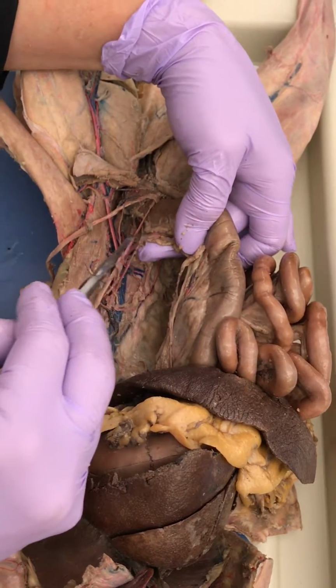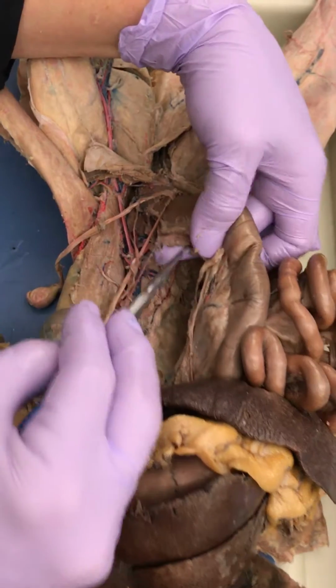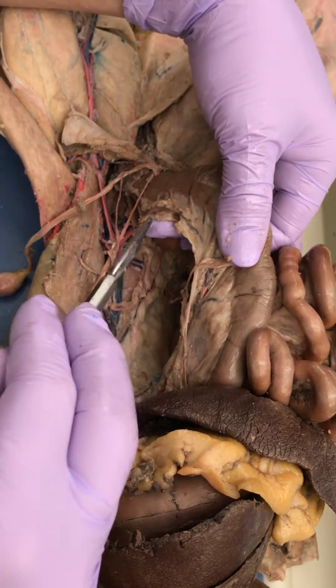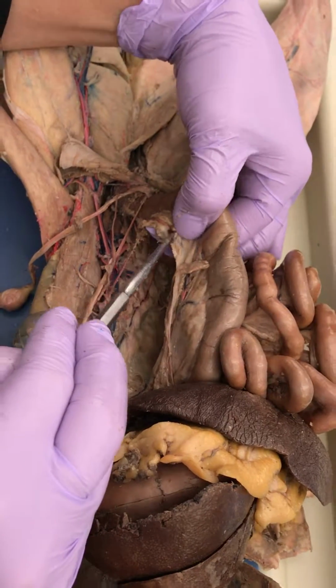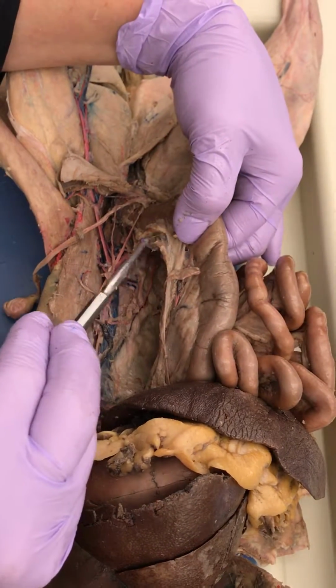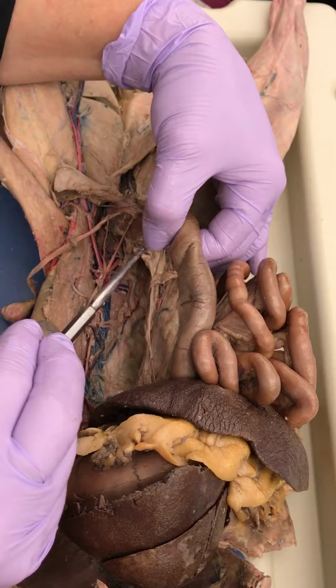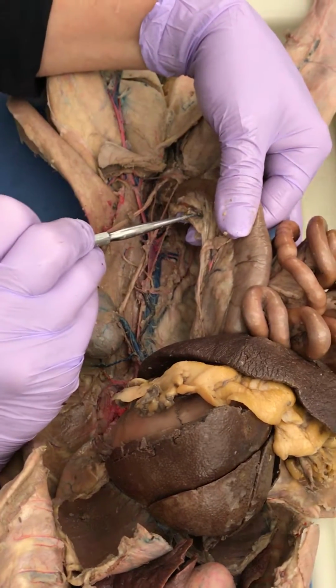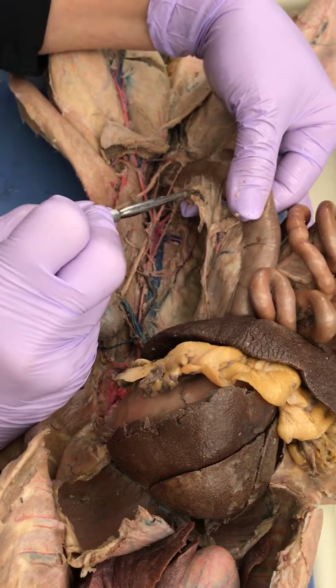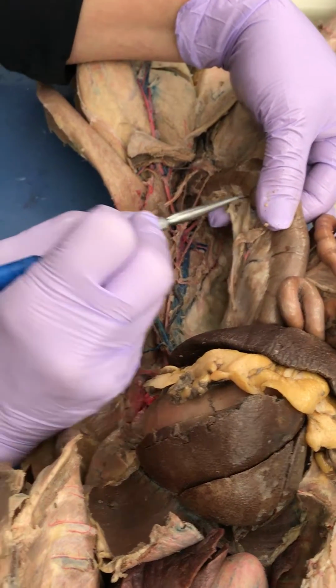Okay, and then it's a little weak, but I got an artery right there. It is weak, I agree. It's running all the way up the colon. Oh, dang it, where's my list? I can't remember. It's running up the colon. Is it the colic? It's the colic. And we just went over that one.